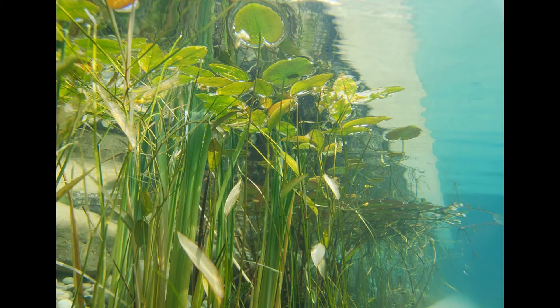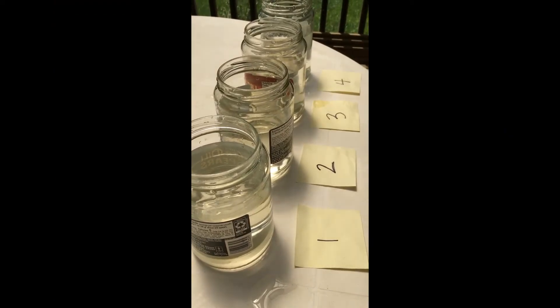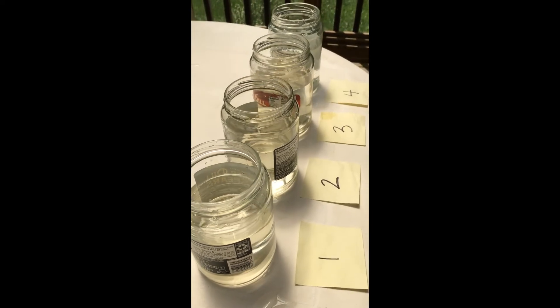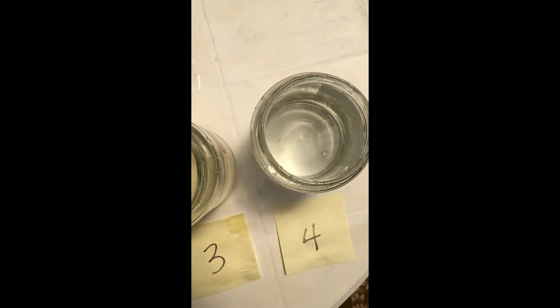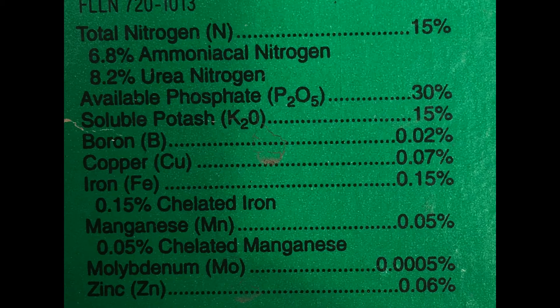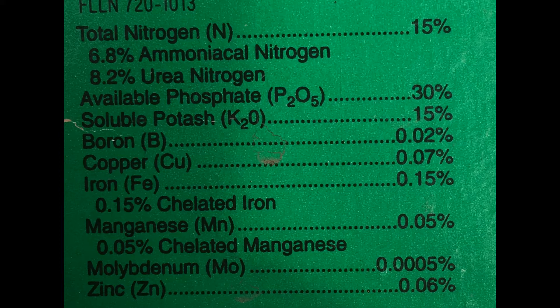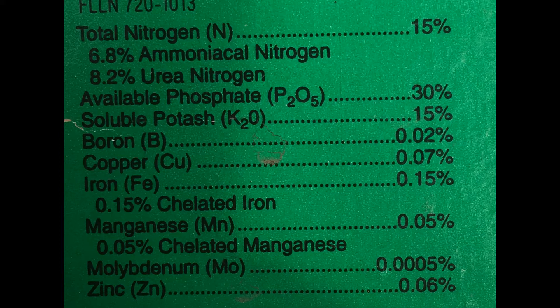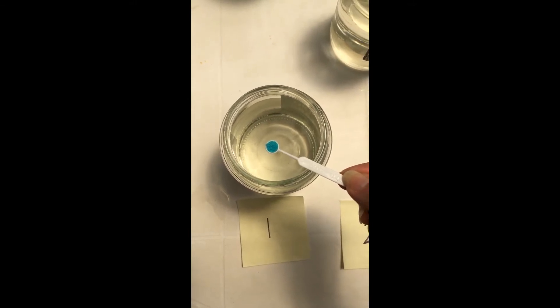Now let's start our experiment to see which variables contribute to nutrient pollution. I have four containers, each with the same amount of water. Containers one through three contain stream water, and container four contains distilled water. For this experiment, I'm using household plant fertilizer. If you take a look at the ingredients list, you will see nitrogen and phosphorus are two of the main ingredients. I'm going to add 100 milligrams of fertilizer to containers one, two, and four.